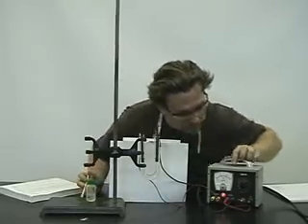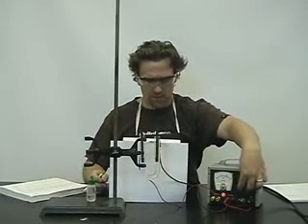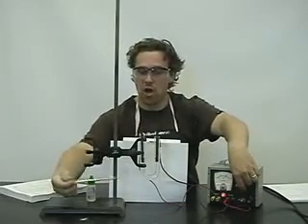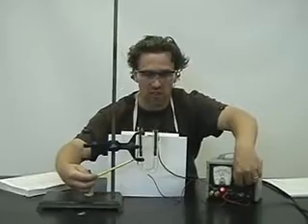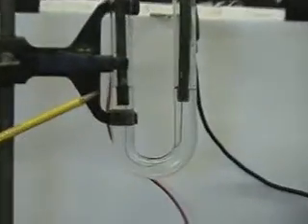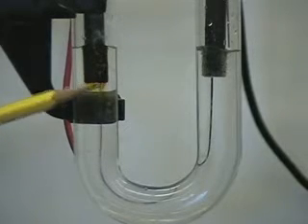So we'll turn the power on and slowly start adding some voltage. Almost immediately you'll notice the yellow color of iodine being produced — the yellow-brown color. Let's zoom in and take a look at that. You notice the brown color of the iodine right away. What happens is as the solid is produced, it's dissolved.